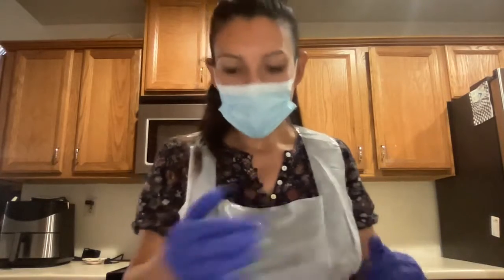Okay, I will be presenting today on the heart, and I have already dissected it so that I can present the interior and the exterior, the anterior and the posterior views of it. I will be naming off the different structures. And when I'm done with that, I will be speaking of a common disease of the heart.